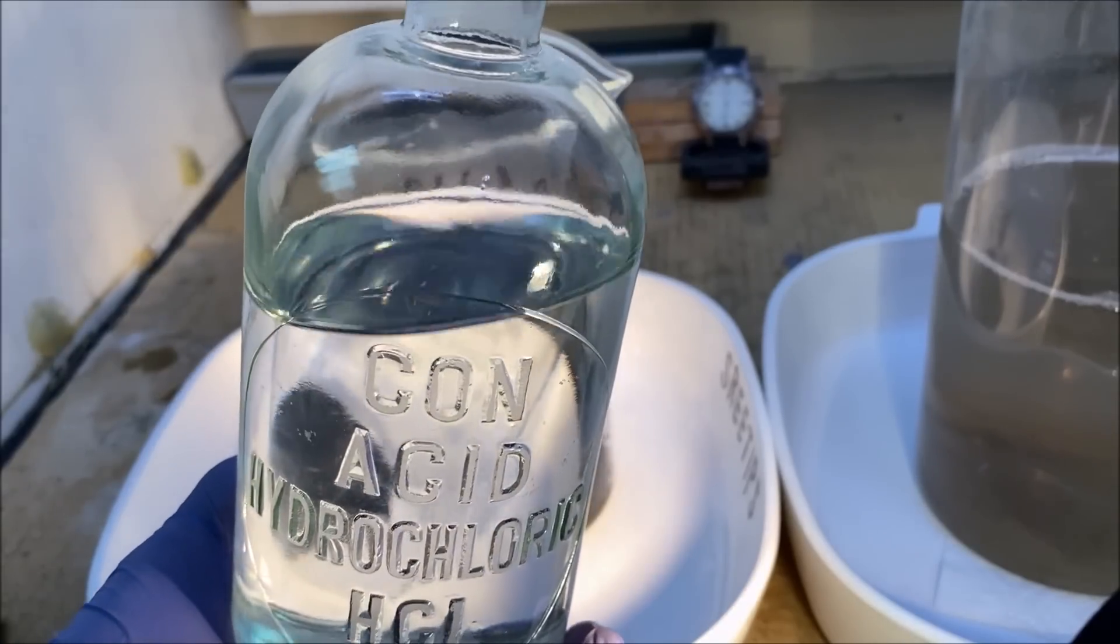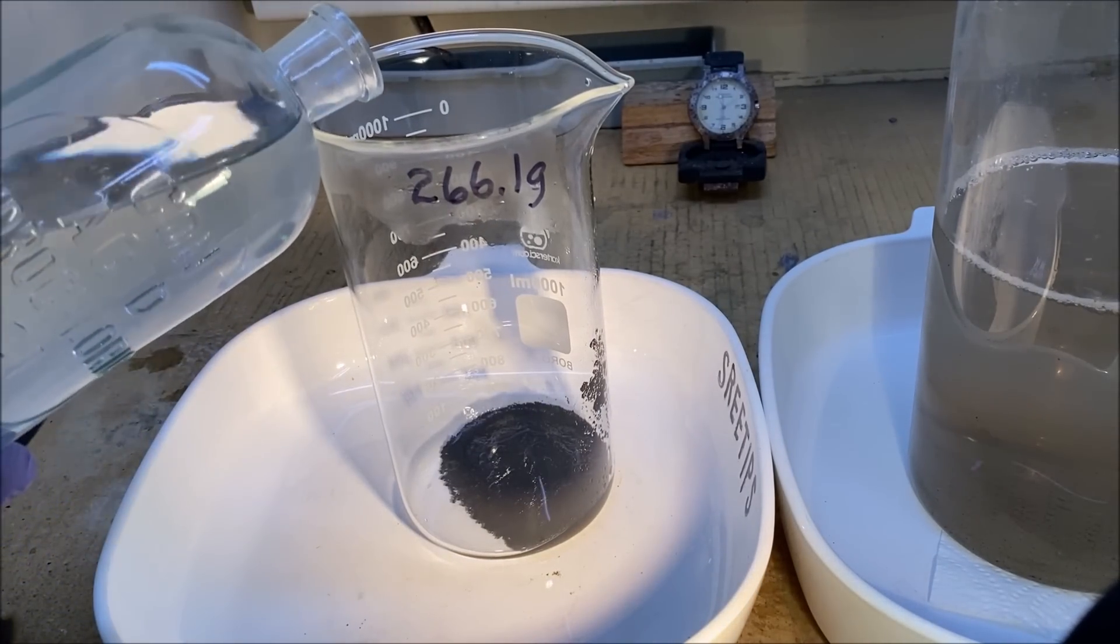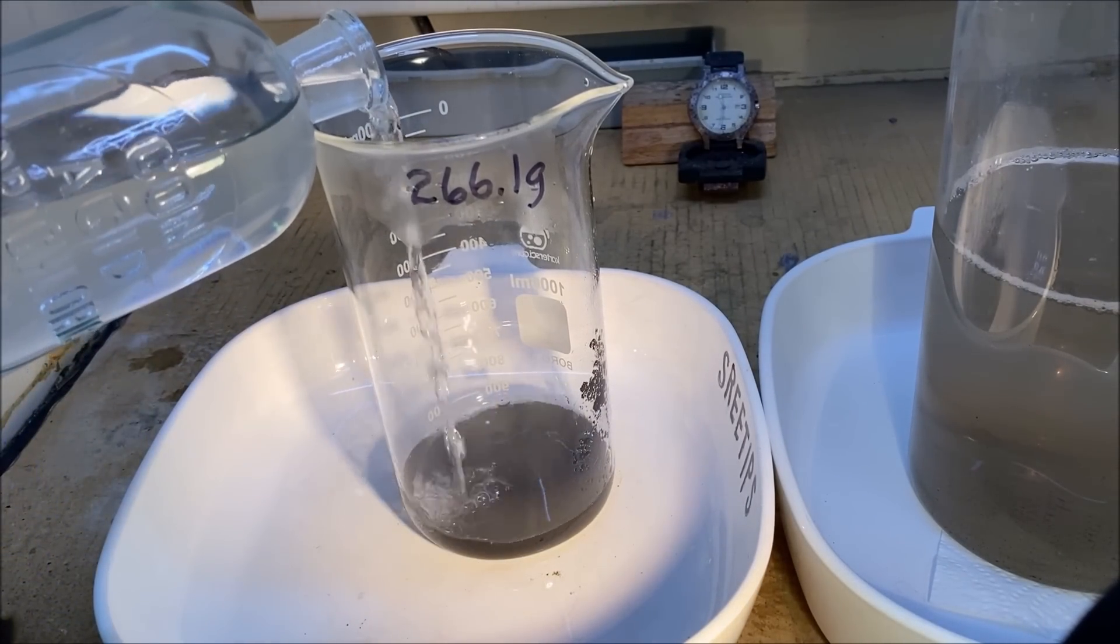I'm going to do one more hydrochloric acid rinse. Make sure I've got all the little pieces of zinc dissolved out of there.